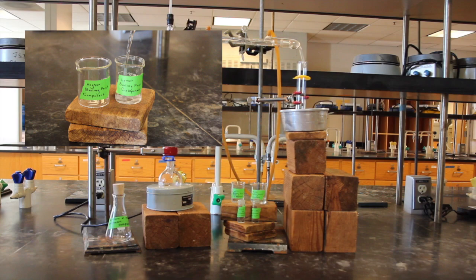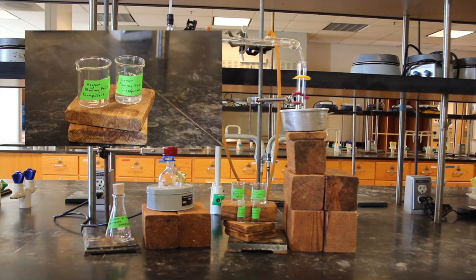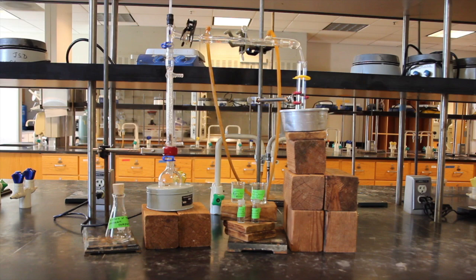Finally, finish collecting the lower boiling component by emptying the graduated cylinder into the correct labeled beaker or flask and then begin collecting the higher boiling component in the same graduated cylinder.